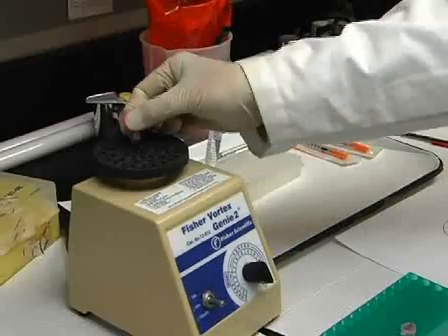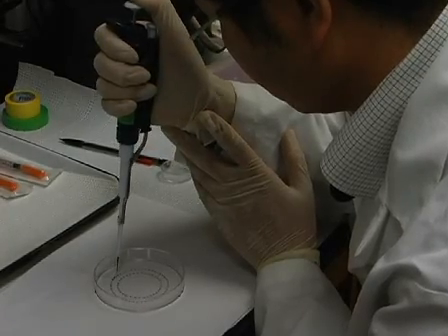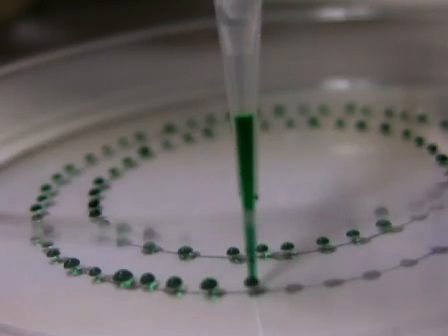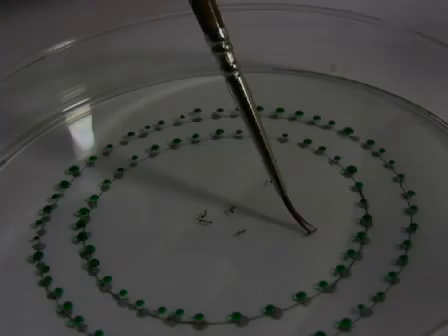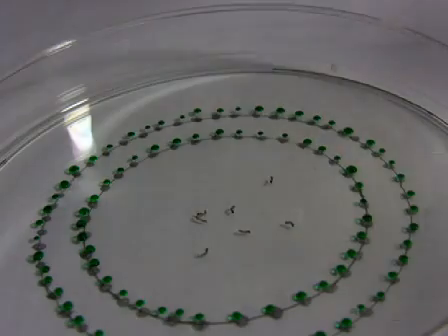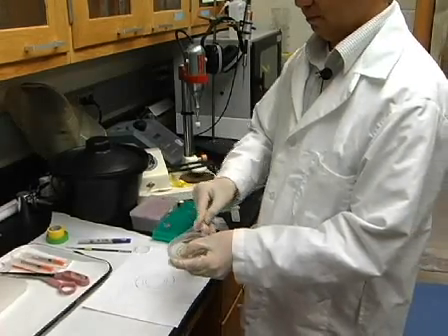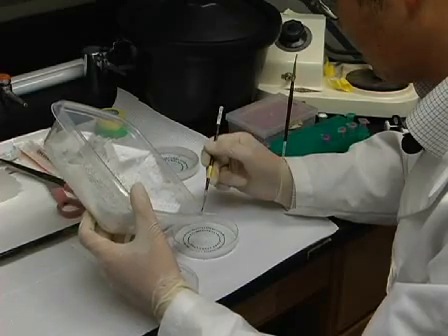After vortexing the tube to prevent settling of the polyhedra, make 2 concentric circles of small droplets of the virus solution in a 60 millimeter Petri dish for each concentration of virus used. Remember to also set up a negative control mock infection treatment. Next, transfer 25 to 30 neonate larvae to the middle of the concentric circles using a sterile paintbrush. Place the lid on the dish and seal with parafilm to prevent the larvae from escaping. Ideally, use different paintbrushes for the transfer to each virus type to prevent contamination between treatments.